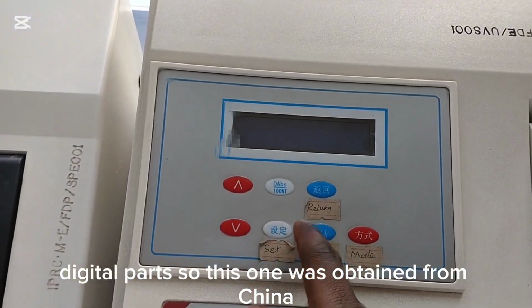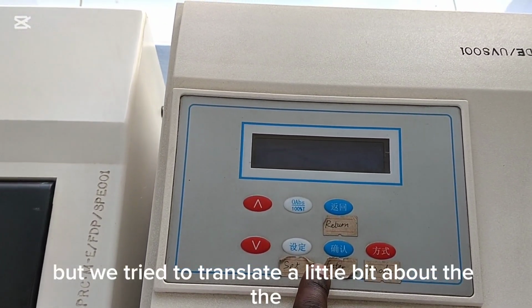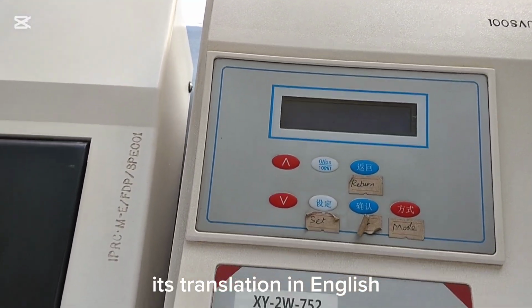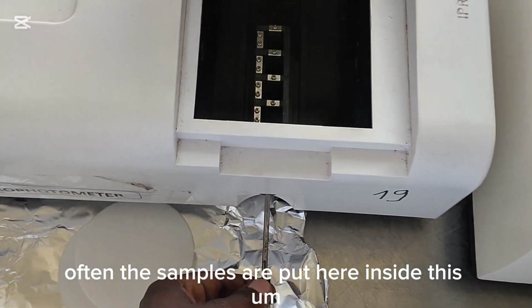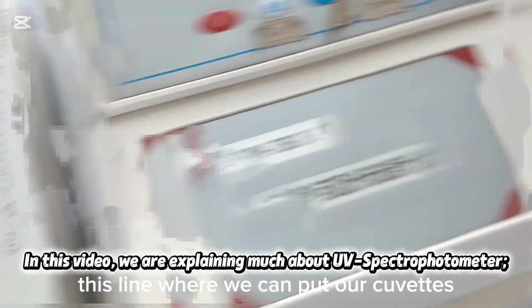So this one was obtained from China. That's why you can see Chinese. But we tried to translate a little bit of it into English. Then, where do we put the sample? Often the samples are put inside this line where we can put our cuvettes.